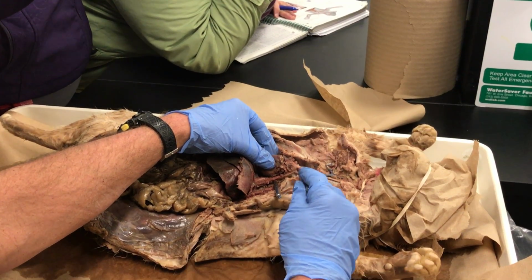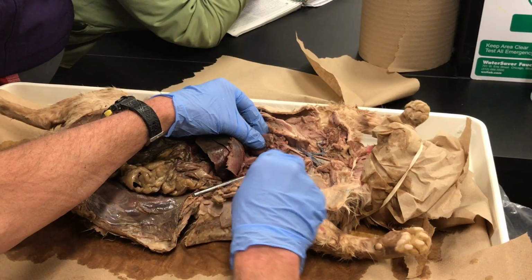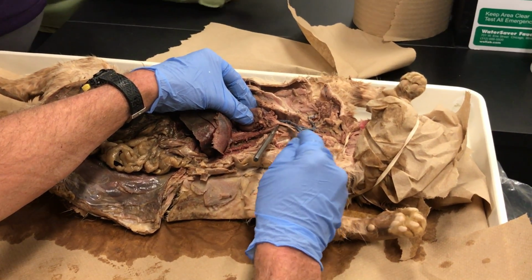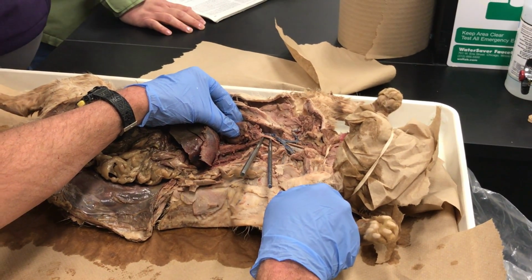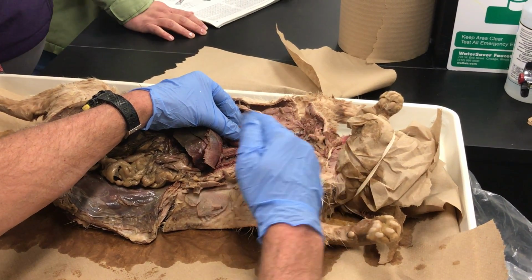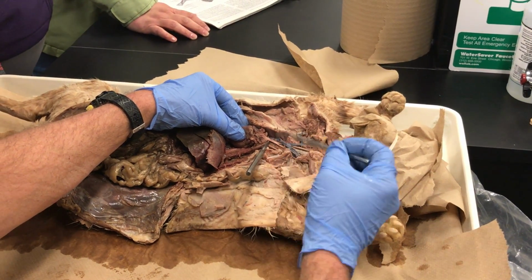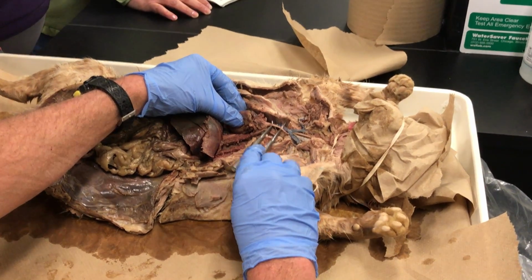This first big pipe right there that begins right off the aorta and ends right about here, that is called the brachiocephalic artery. So it comes off of the aorta and heads up towards the right forelimb and towards the head. The first branch right here, see where there's a pink pipe that's coming off of there?